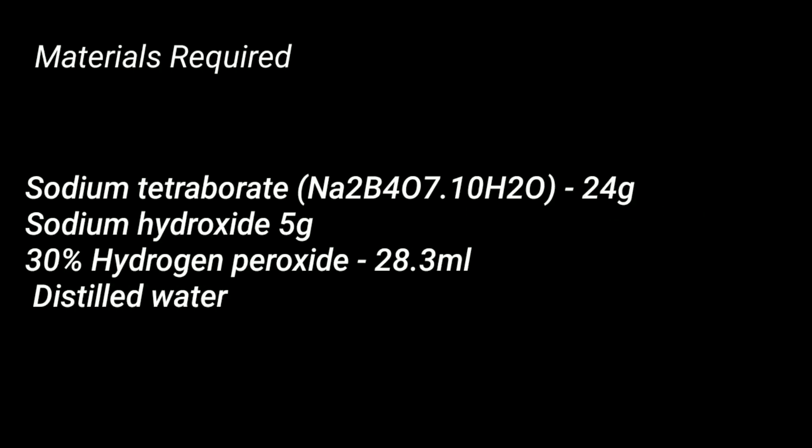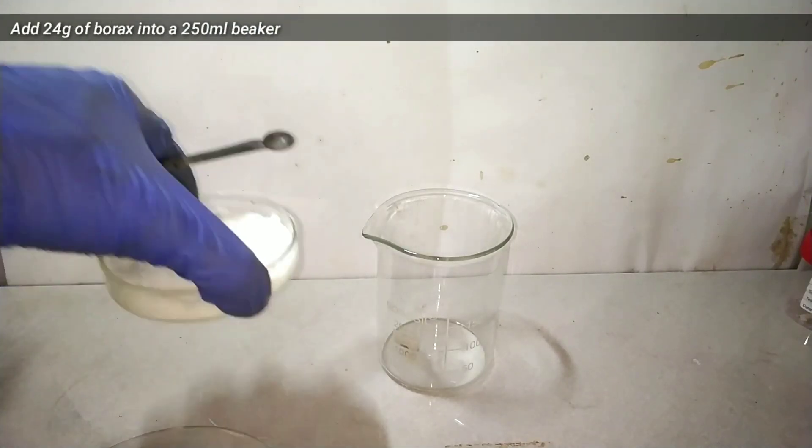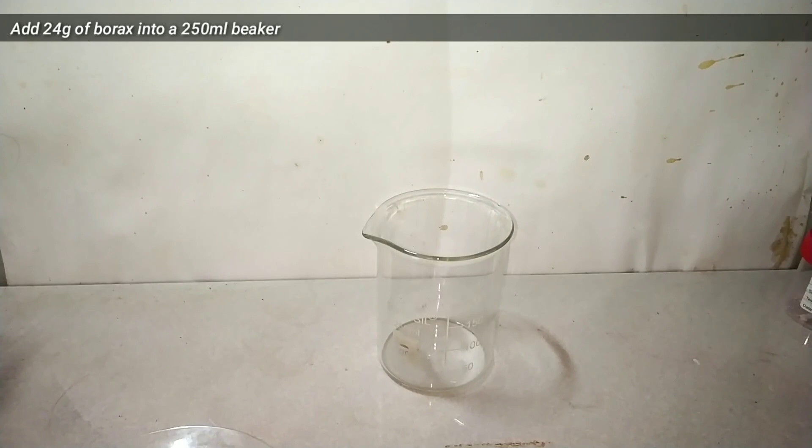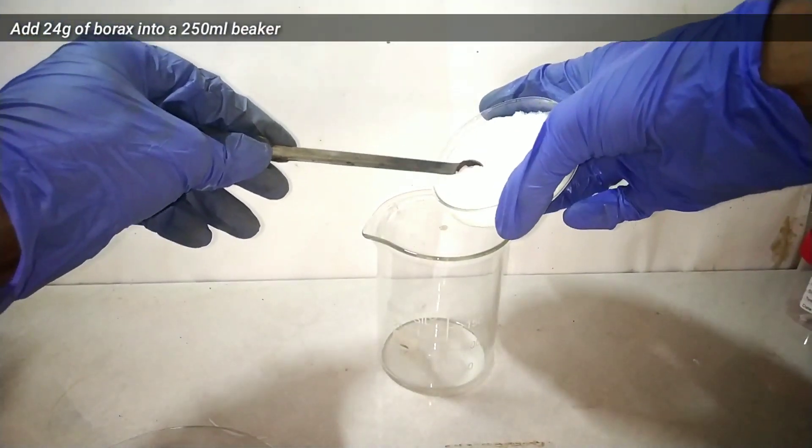Materials required for the synthesis include sodium tetraborate, commonly known as borax; sodium hydroxide, available as lye; and hydrogen peroxide, available from medical stores as 3% — though I am using the 30% concentration.